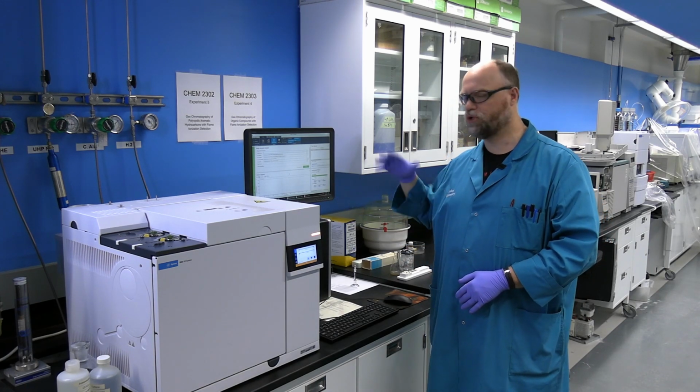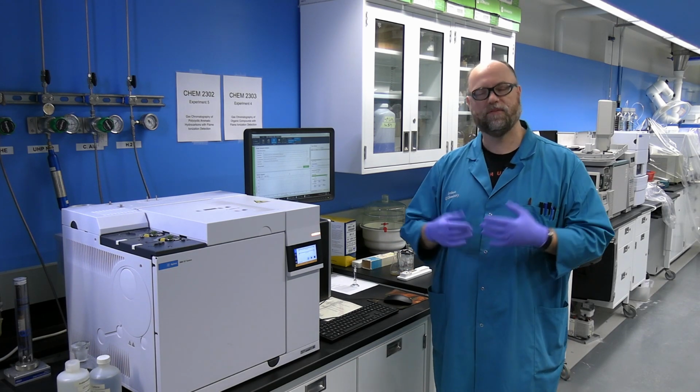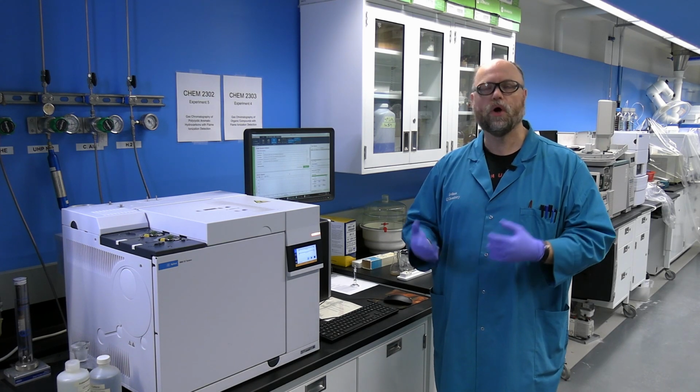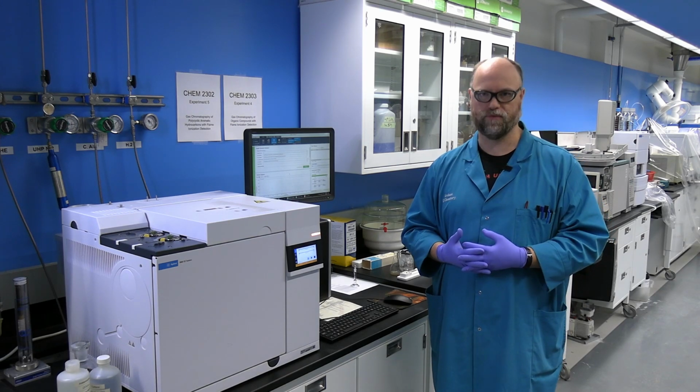This system should be already set up and ready for you when you come to the lab. If for some reason when you arrive at the lab it is not set up, please see the lab coordinator or your TA in order to get the system up and running and ready for you.